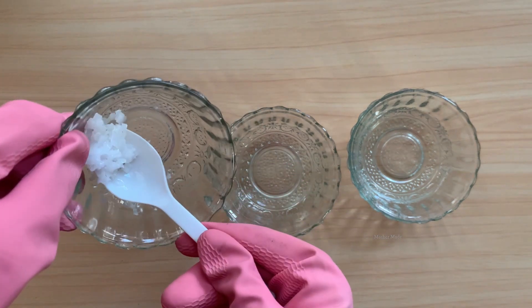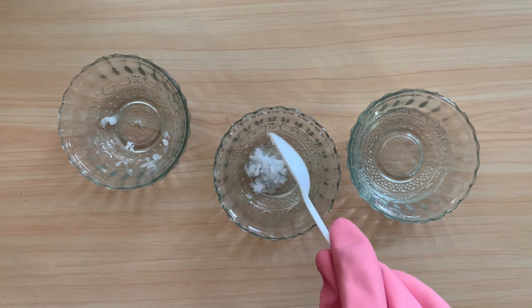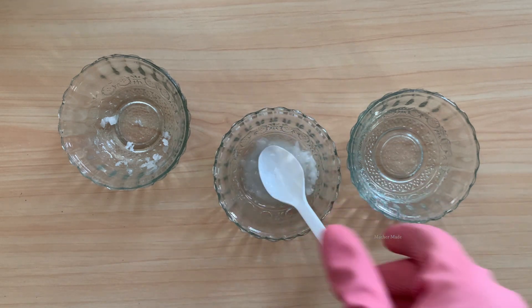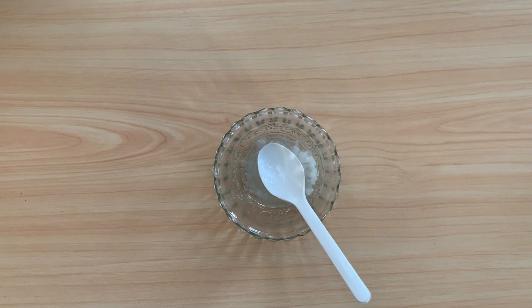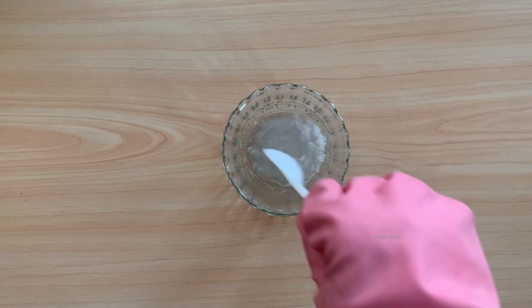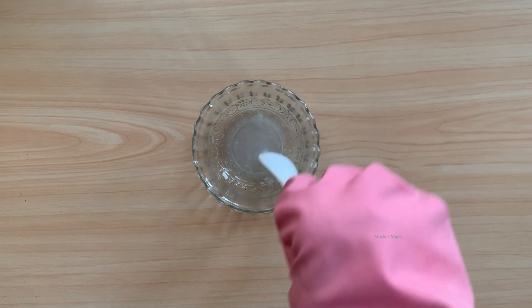First I am taking some water in the vessel. Now I am adding caustic soda into the water. After that, mix it thoroughly. Mix until all the flakes of sodium hydroxide dissolve in the water. Not a single particle should remain undissolved.